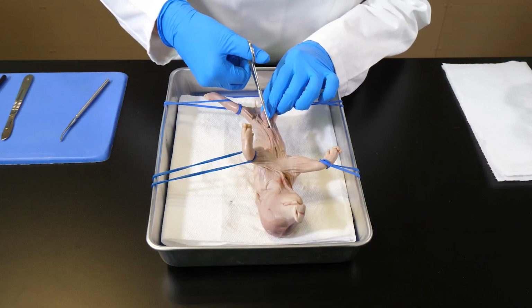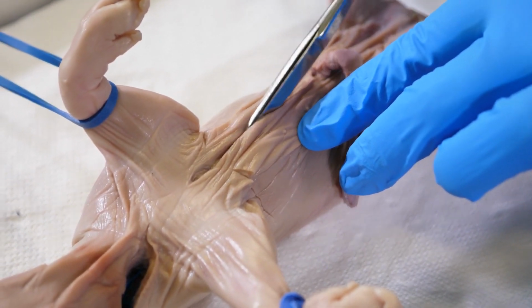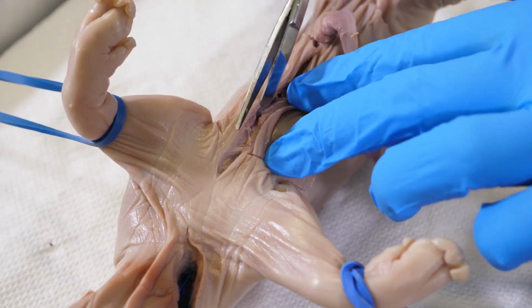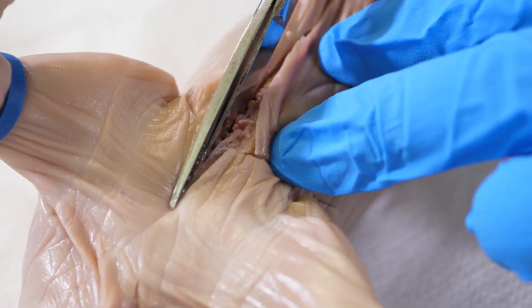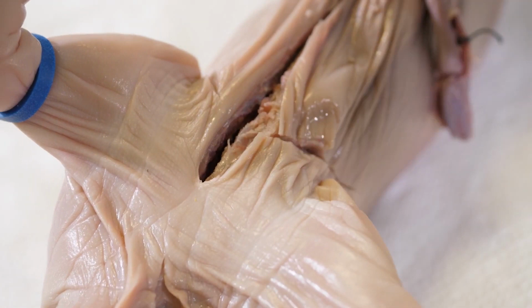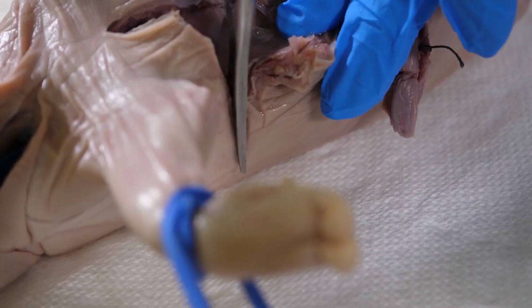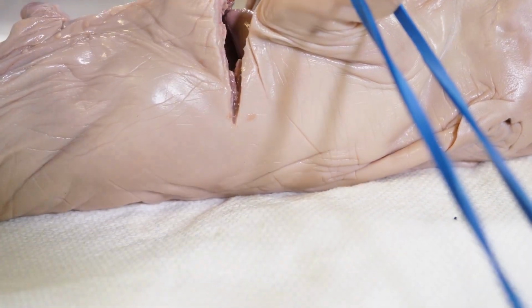With the blunt scissors, we follow our previous incisions to cut through the muscle layers. As we cut toward the sternum, we pull up on the incised skin to keep it away from the internal organs. Next, we cut up through the sternum and ribs near the anterior end of the medial incision. Since the fetal pig skeleton is mostly cartilaginous, we can cut through it with scissors. We follow the transverse incisions near the forelegs and cut through the muscle layers with the blunt scissors. We also cut through more ribs.